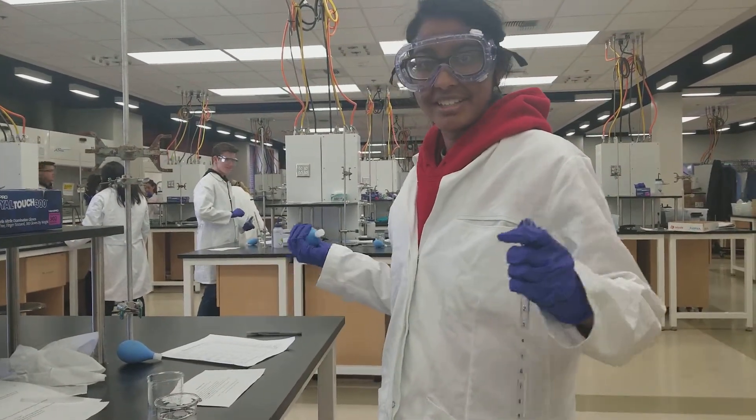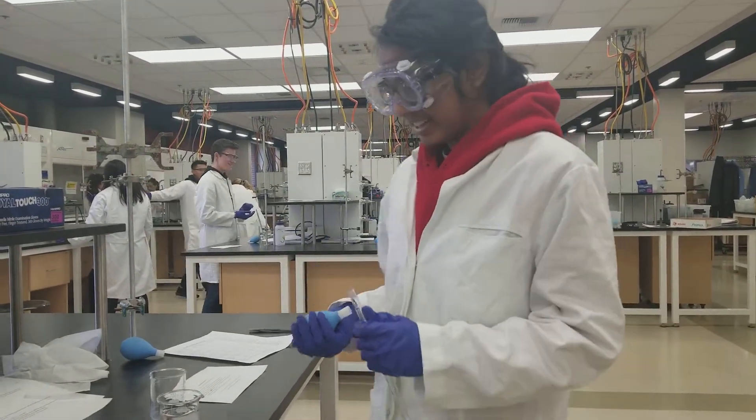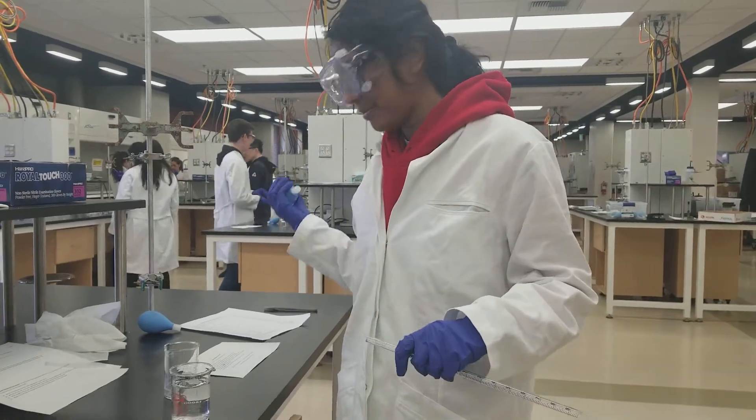Hello, my name is Miha Omegesh. My TA is J.D. I'm going to show you how to get the pipette badge.